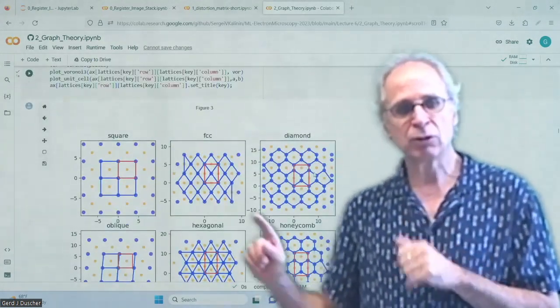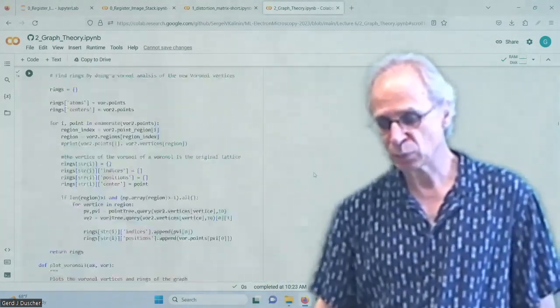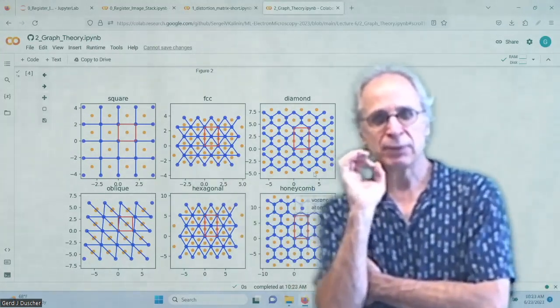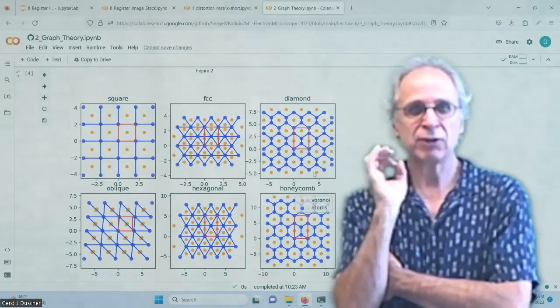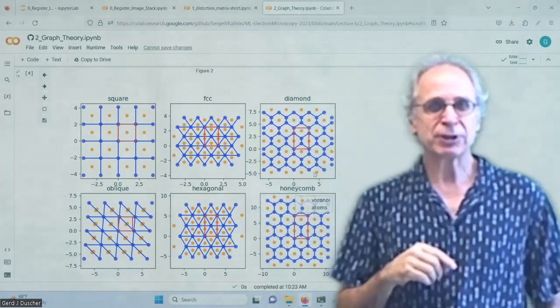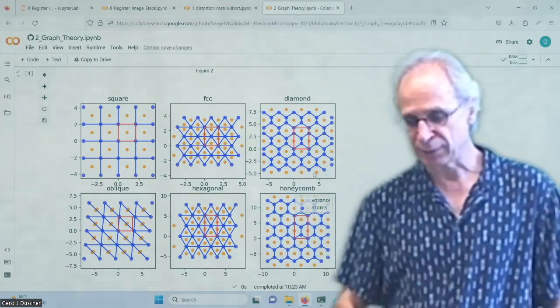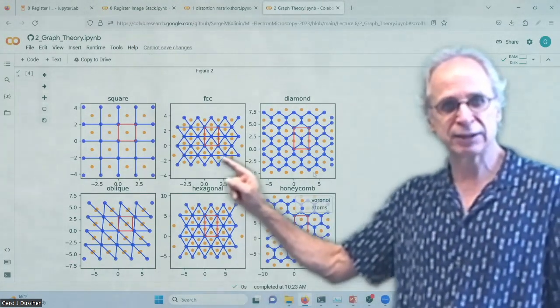If I now look at the Voronoi vertices, so I had two here, and these are too close together. Let's think about them, now that we do crystallography, as interstitials. If you have two interstitials and they overlap, obviously it's one big interstitial. So that's what I'm trying to do here. I'm trying to get overlapping interstitials. And if they overlap, I use them as one. And so in this case, it's non-overlapping, and in this case, I say they're overlapping.